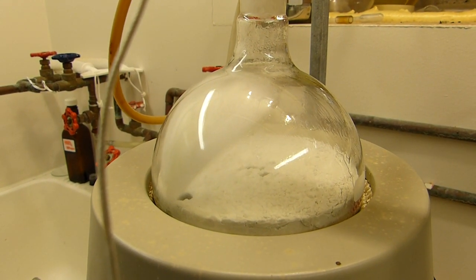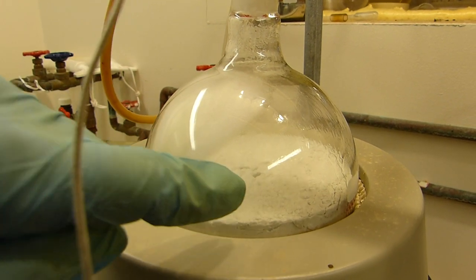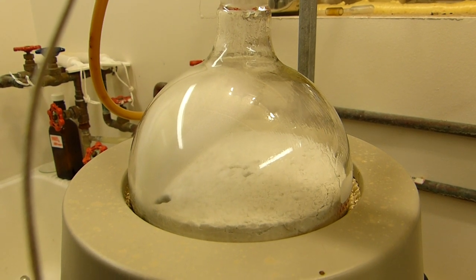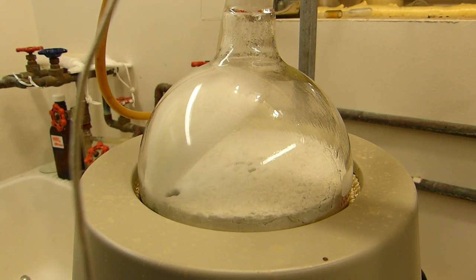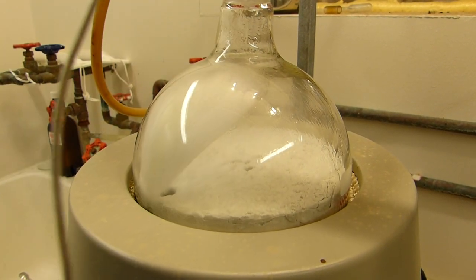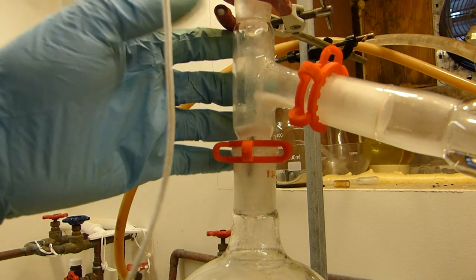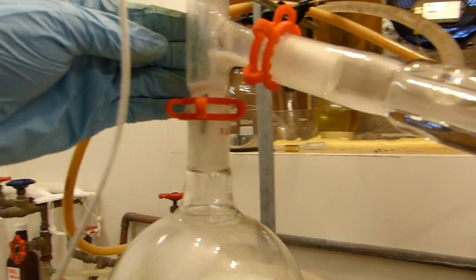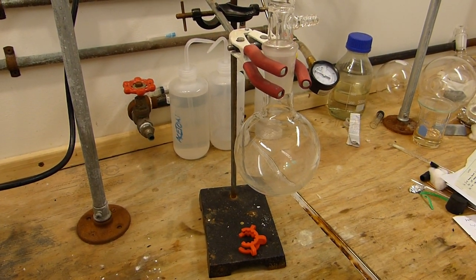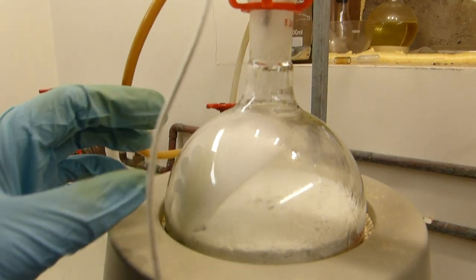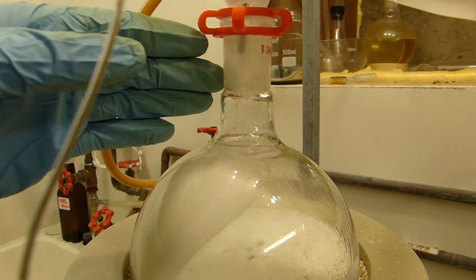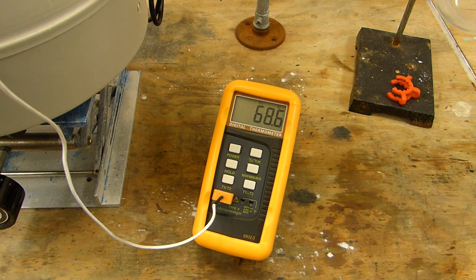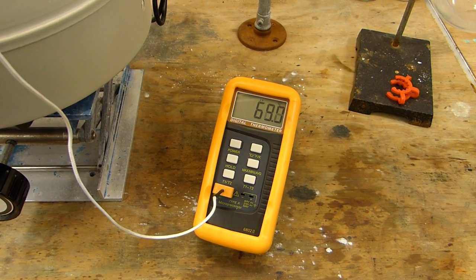All right I've been heating for about 25 minutes now and you can see that the level of the powder has sort of shifted down and there's some little volcanoes there in the middle where you can occasionally see a bubble of some thick black liquid come through. Originally this haze of nicotinic acid was covering the flask uniformly but then pyridine started to come through fairly rapidly and wash it back down. So there's definitely some action happening in there and you can see that there is pyridine condensing in the still head but not quite in the condenser yet. There's also a haze of nicotinic acid which is formed which is going to of course be carried down by the pyridine into the receiver, which is why we're going to have to redistill this after we run the decarboxylation just to remove that excess nicotinic acid or niacin right. So now just keep heating this, you can see we're just now starting to reflux, still head's at 68°C, not bad. A few more minutes and we'll be taking pyridine off this.